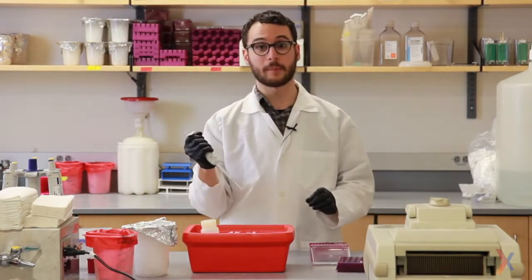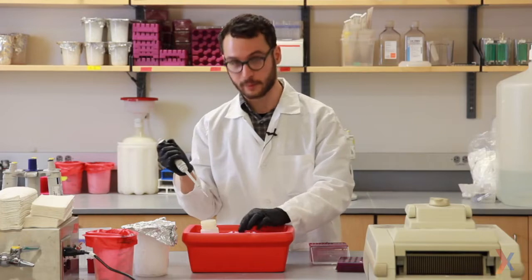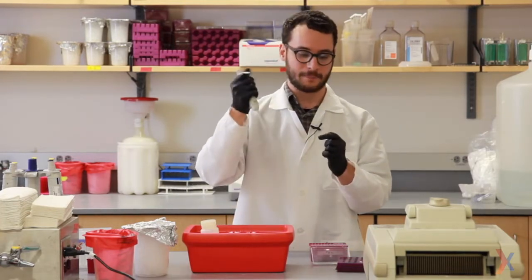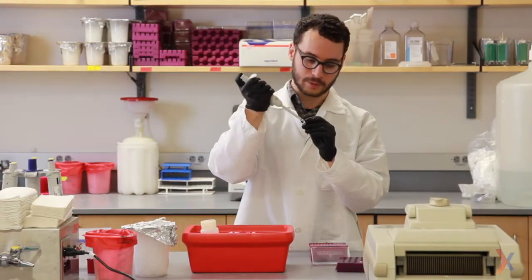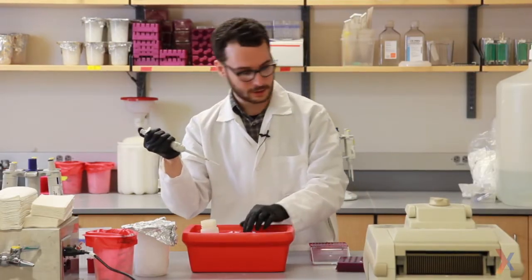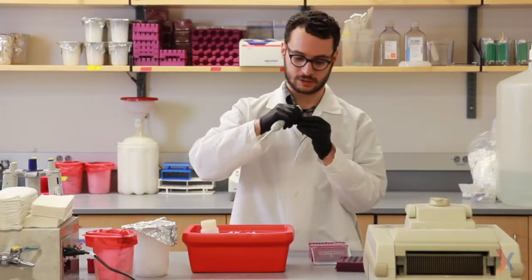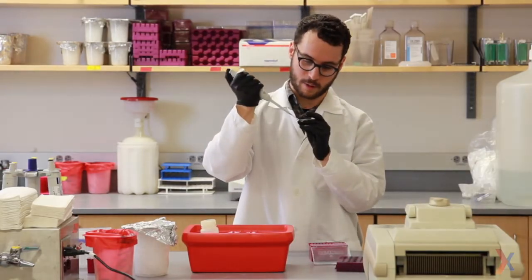Next, I'll need to add my primers. I'll be adding the forward primer and the reverse primer separately. The final concentrations of these primers will be one micromolar, but you may need to troubleshoot this for a different PCR. You may need more or less. So first is the forward primer.